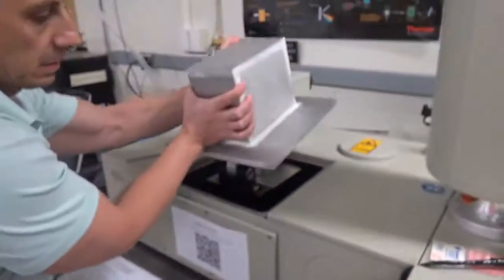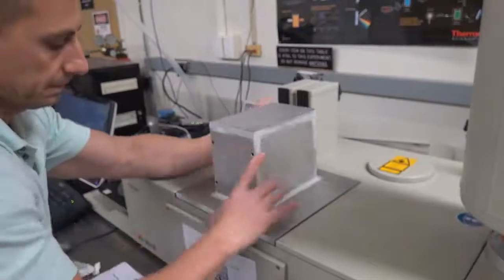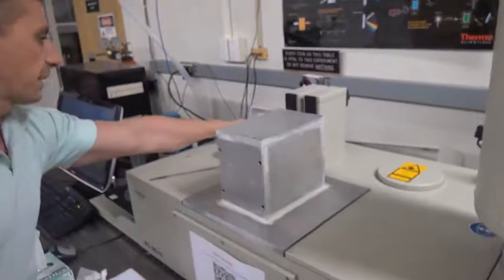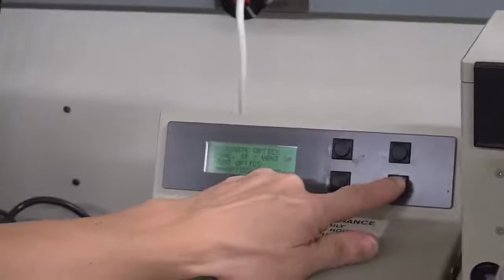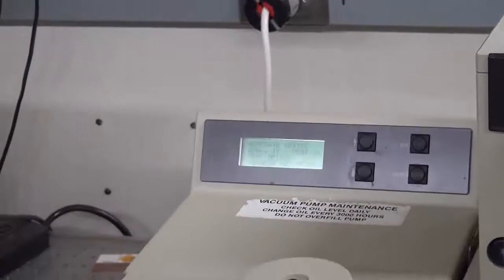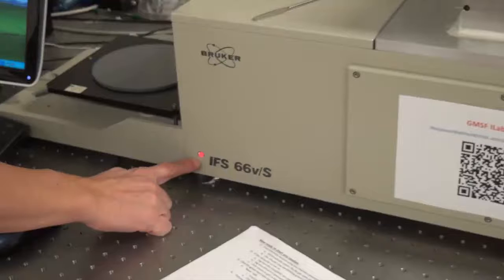Place the lid back on and evacuate the system. You evacuate the system by pushing the up arrow until Evacuate Optics is selected and then push Enter. At this point, you are ready to start your session.